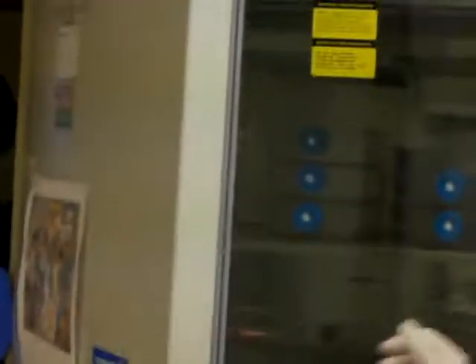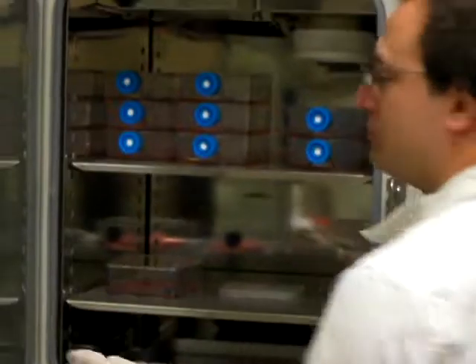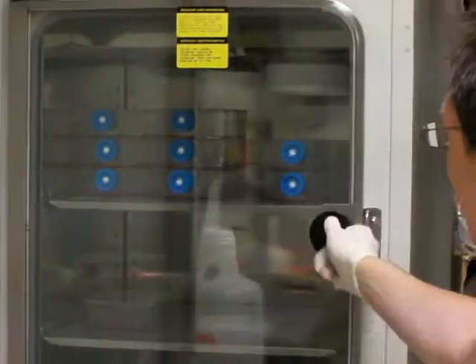And that's it. You put it back in the nice warm CO2 incubator and let them grow for a few days. You can see there's a lot of other cells in here — mine will just go here. Thanks for looking at our video on fun science.